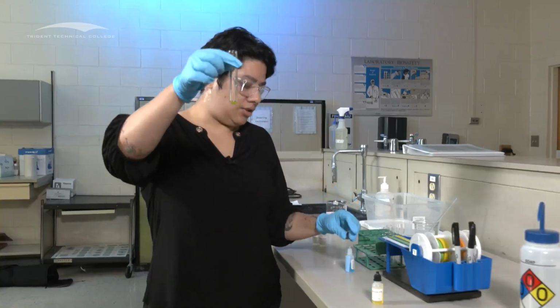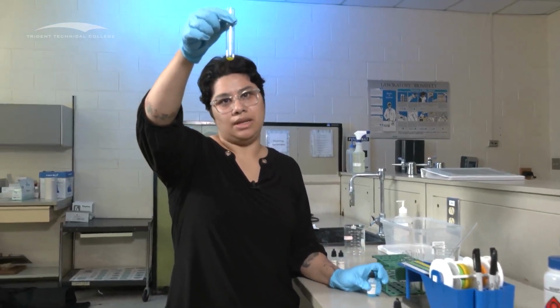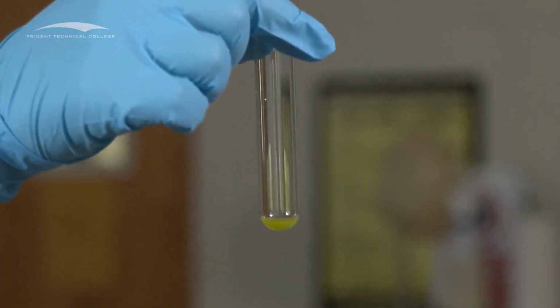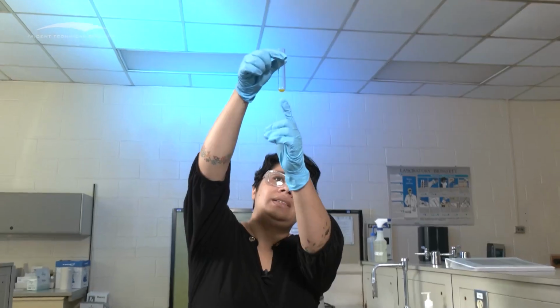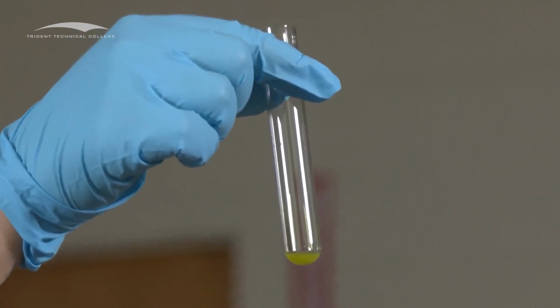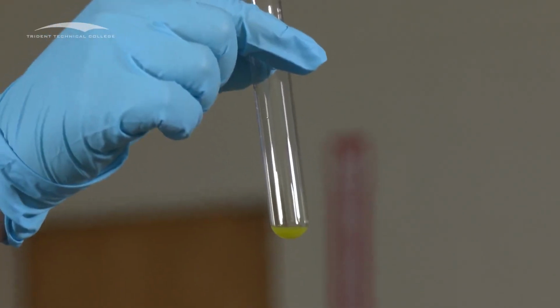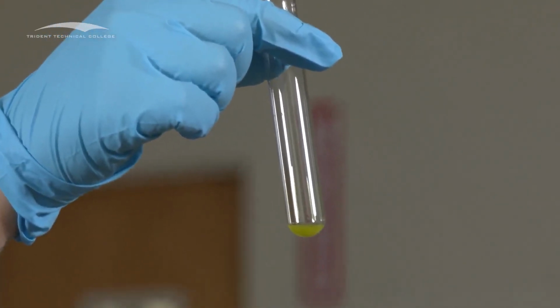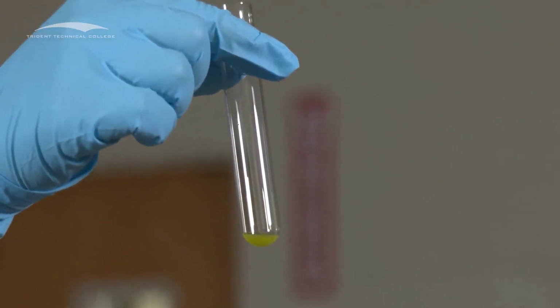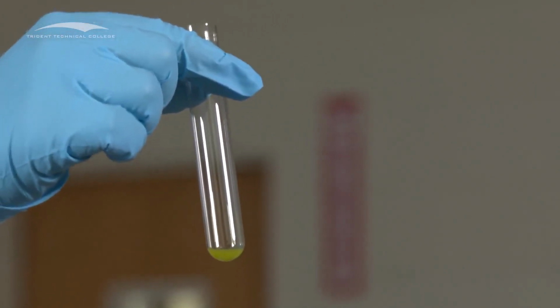So this one, I want to show you this one specifically, because I want to show you what a precipitate looks like. If you go like this, you can see that this is very cloudy right here. That's what you are looking for. So when it's asked you, did it make a precipitate or not, this is what you are aiming to find. You're trying to find a cloudy kind of powder, and that is going to be your precipitate. If it looks clear, then that's going to be no precipitate. If you see a cloudiness, kind of a powder at the bottom, then that is your precipitate.